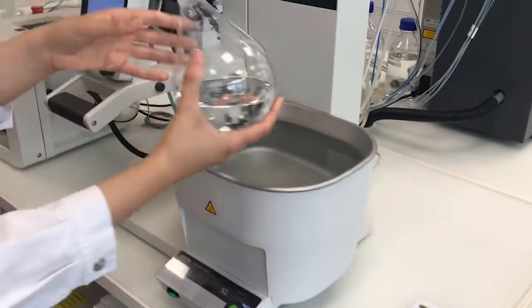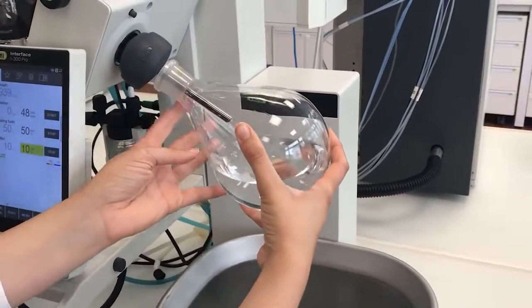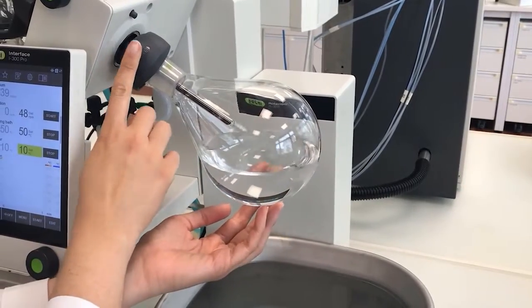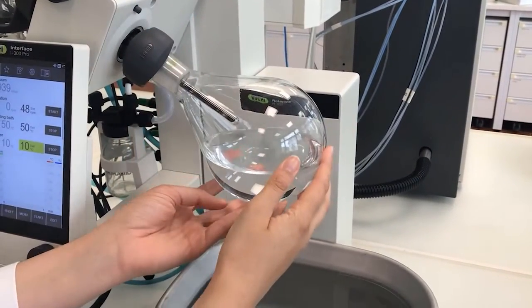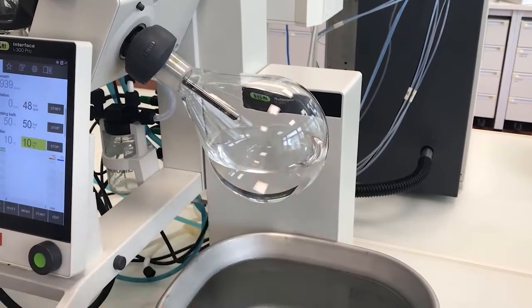Next, we attach the flask to the vapor duct and close the combi clip. We recommend not to tighten the combi clip too much since we will be under vacuum.